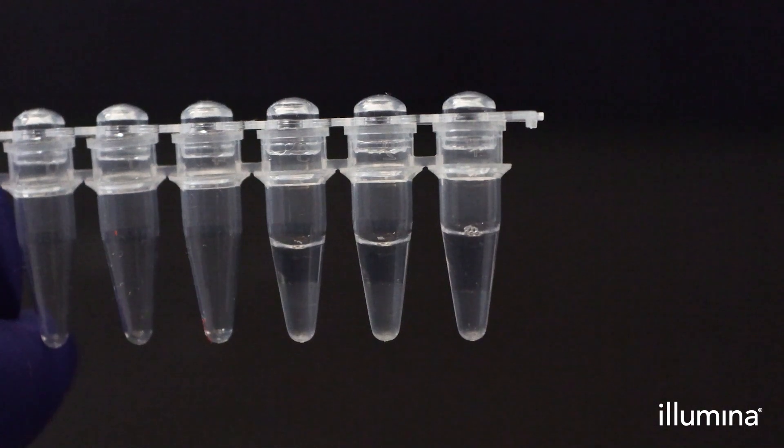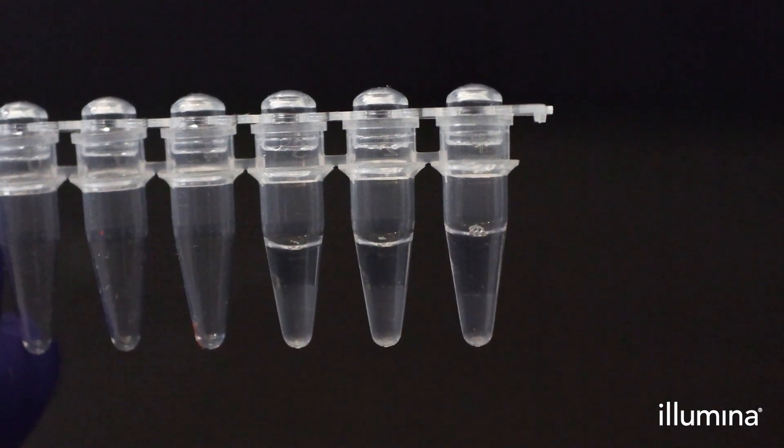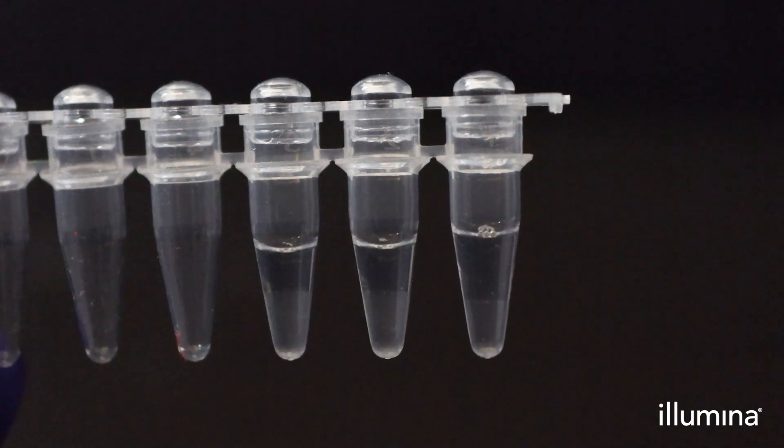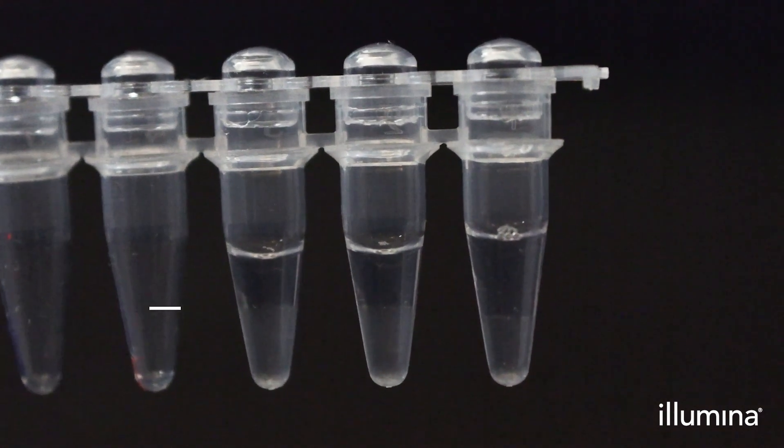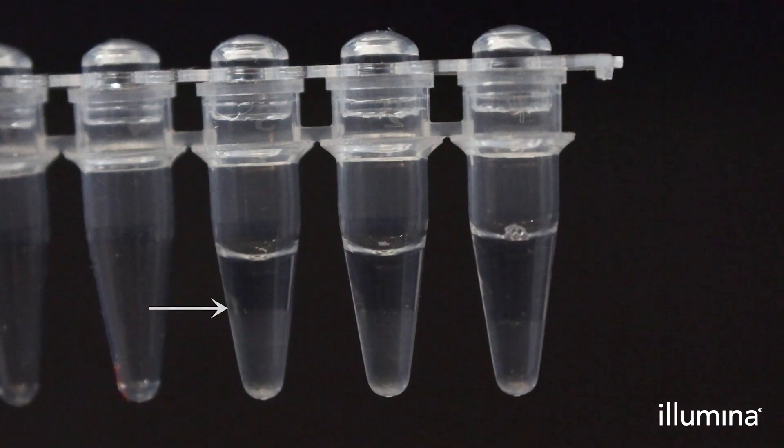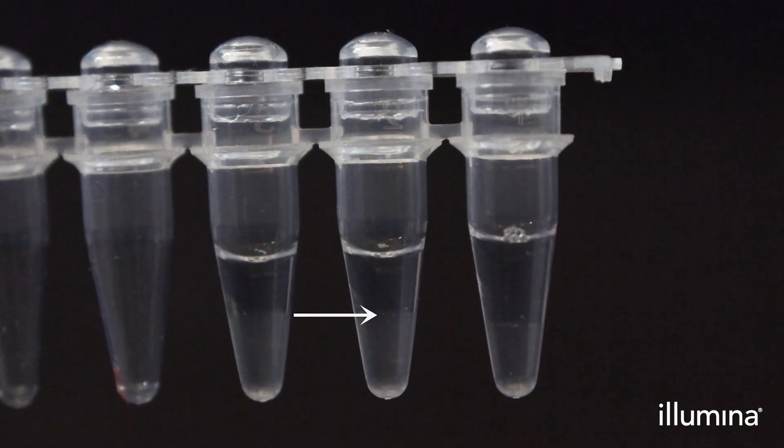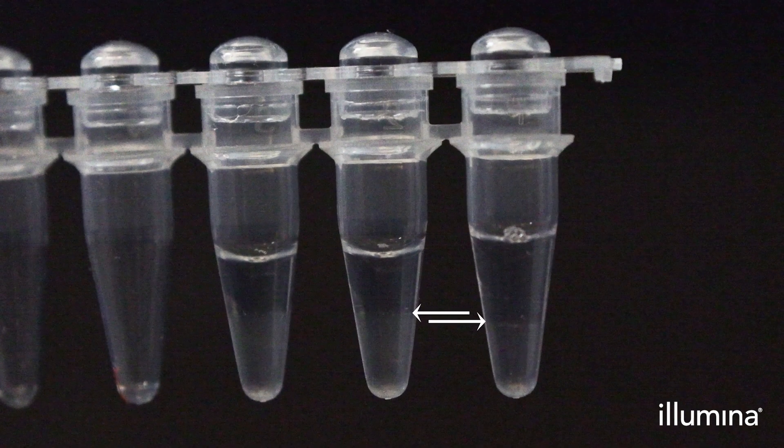After transferring your fourth and final wash into PCR tubes and spinning down the fluid in a plate fuge, remove the 8-tube strip from the red guide rack and check each of your sample pips pellets. Note if there are any samples with obvious bead loss in your lab notebook.